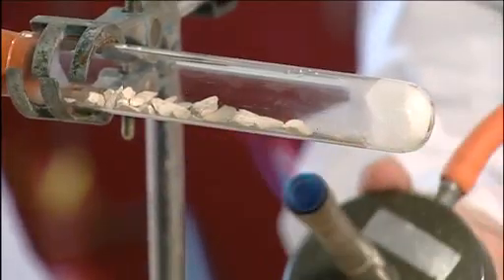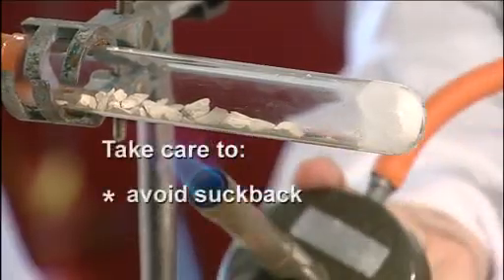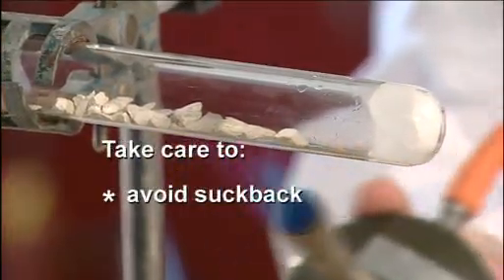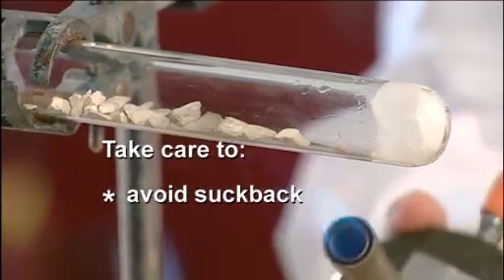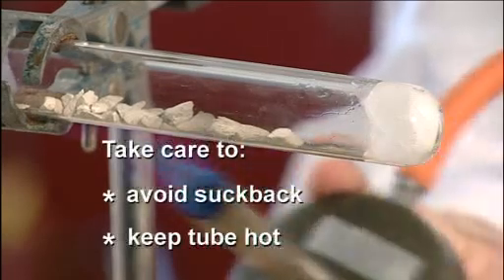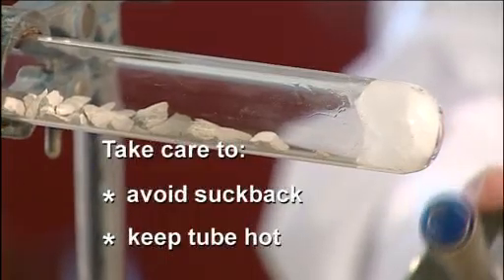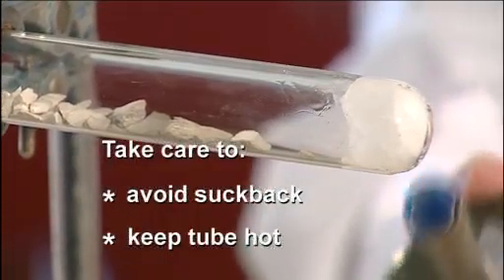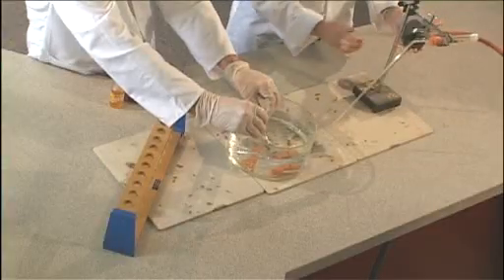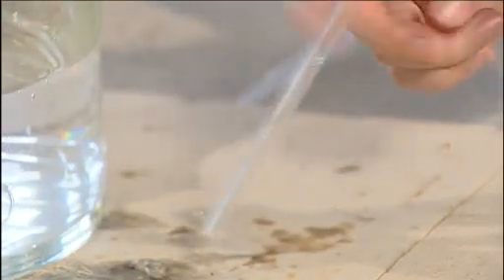It is important to keep the boiling tube and its contents hot. If it is allowed to cool water may be sucked back into the boiling tube and it can cause the boiling tube to crack. It's vital to watch the delivery tube for signs of suck back. If this seems to be starting the solution is to continue to heat the boiling tube with the hottest part of the flame just beyond the blue cone and to remove the whole thing from the water. It is tempting to push the Bunsen closer to the boiling tube or to remove the heat both of which will increase suck back. And you can see there are some water drops coming up the tube and if I just keep heating those then they should come out.